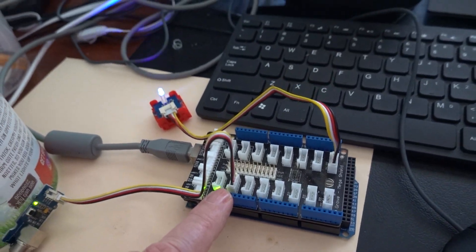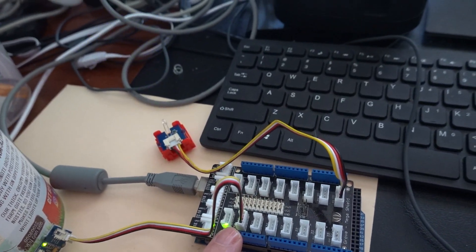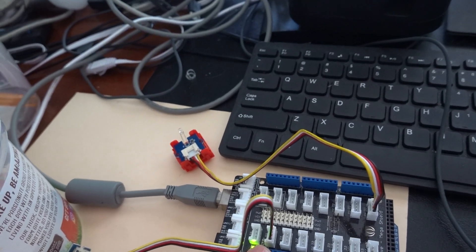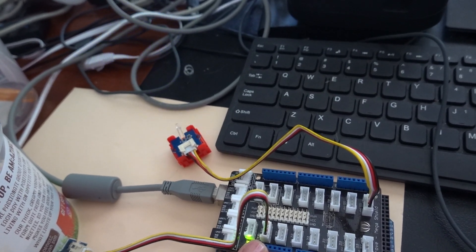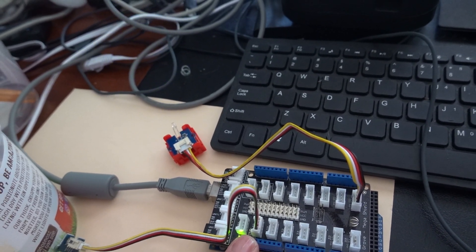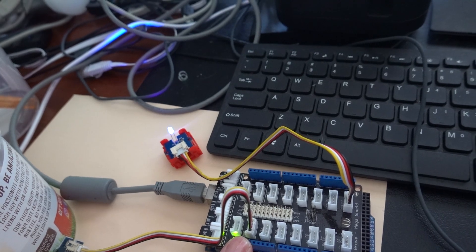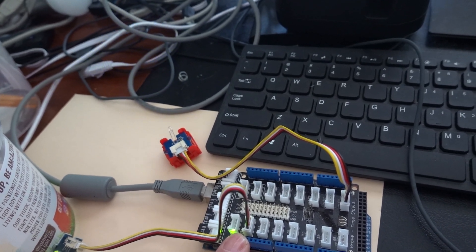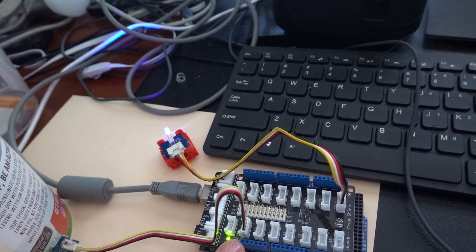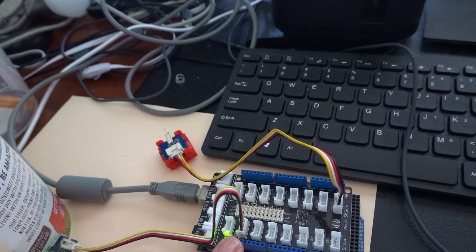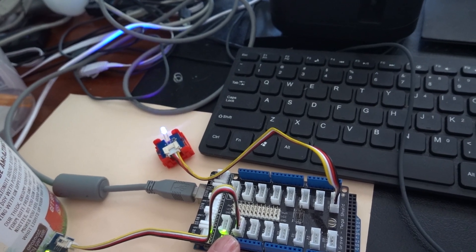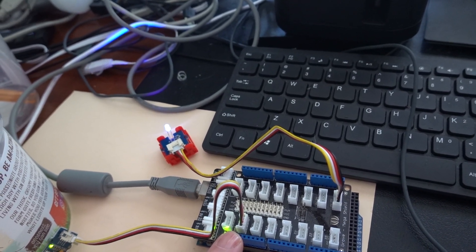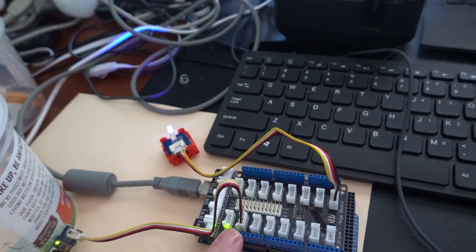We also have a Grove LED, and when it flashes it means it's completed its calculation. It's going to calculate over a number of samples and give us the average of the ORP reading.